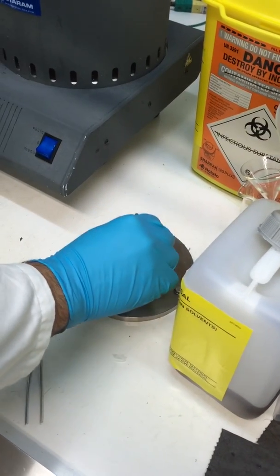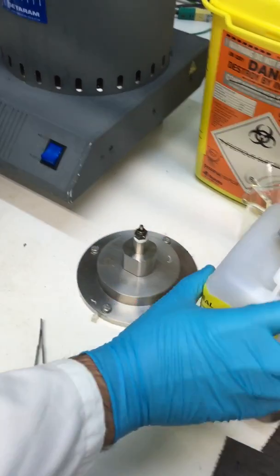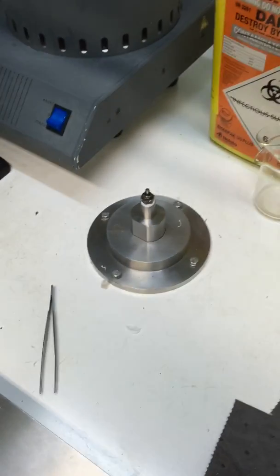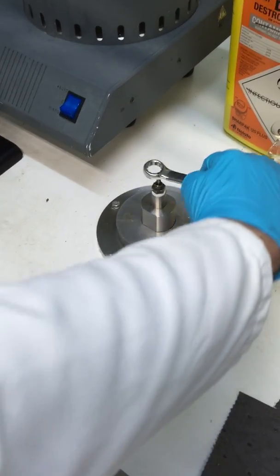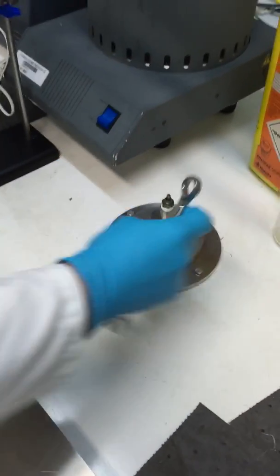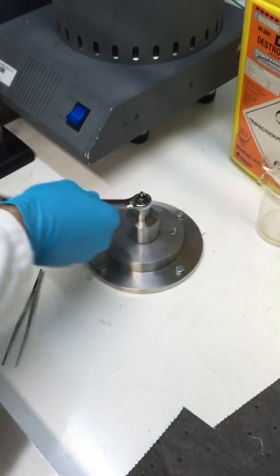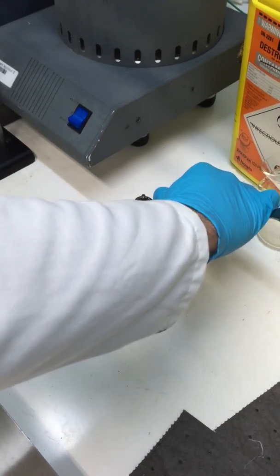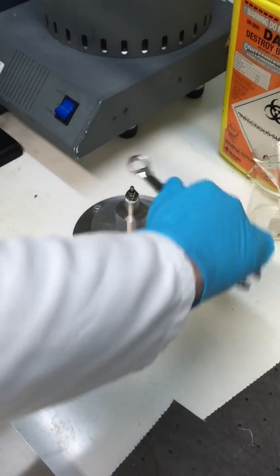We then place that in the C80 cell holding device and use a spanner of the appropriate size to tighten that down to relative tightness so that it can't turn in any further. The Teflon tape ensures a good seal.